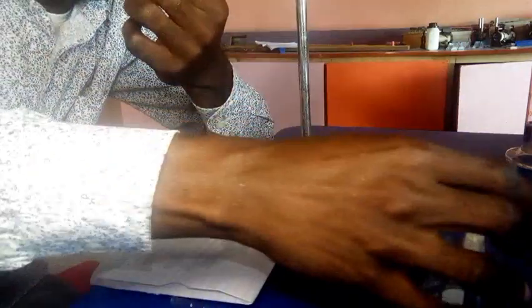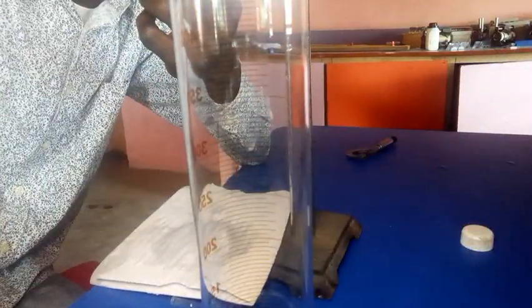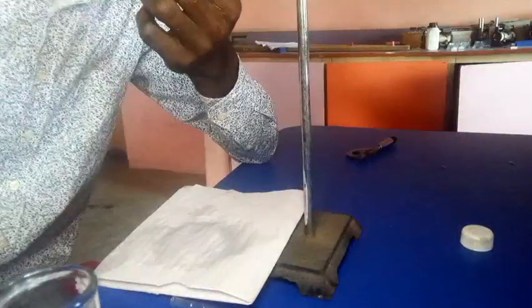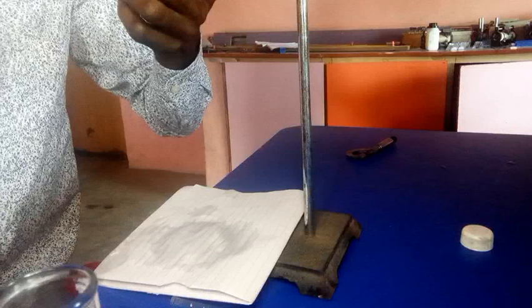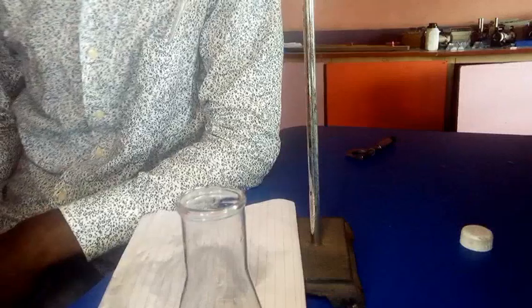So that's just like the previous one we have. I poured it here. So that one is a colorless solution. So if I add it now to see the color very well, you see that it's colorless. Yes, it has changed to colorless, and that is the end of the titration for the second titration, right? And our value still falls within, let's say, 30.0 straight away. Okay, let's record that. So we are going for the last titration.